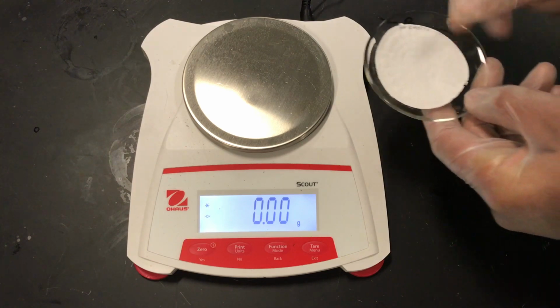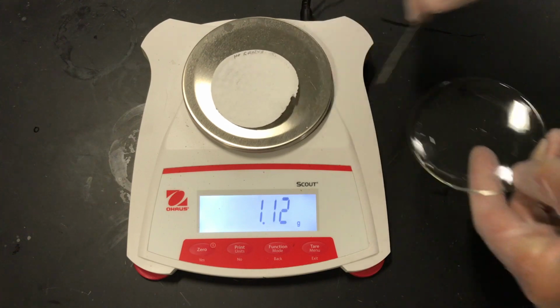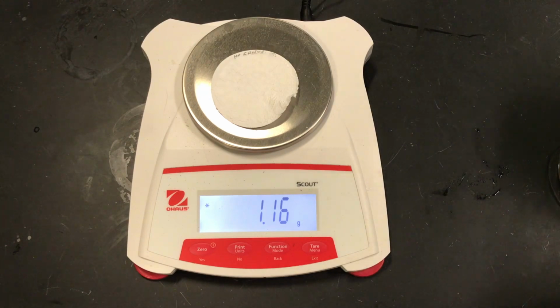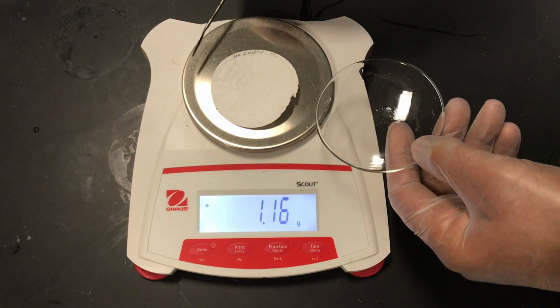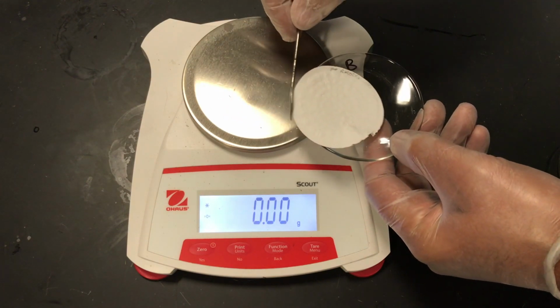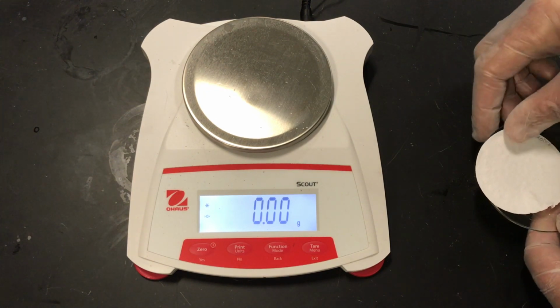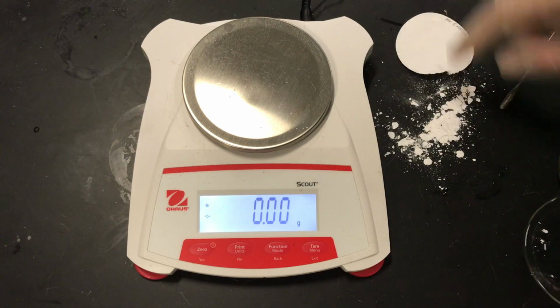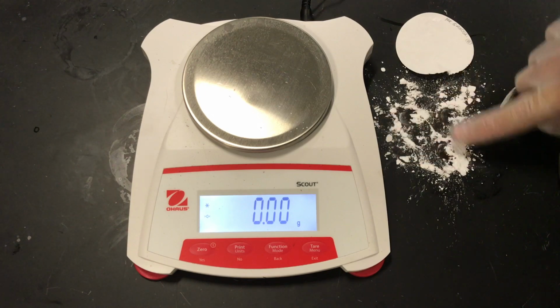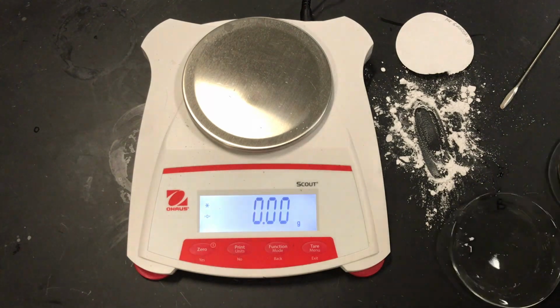Here comes sample B. And that's 1.16 grams of the calcium carbonate dried in filter paper. Of course, subtract out the filter paper for B, and you will have your value of your dried calcium carbonate. And just for fun, since we already have those values, you can see the chalk that we created here. The calcium carbonate, major solid form of the carbon cycle on the Earth. Okay? All right. Hope that helped.